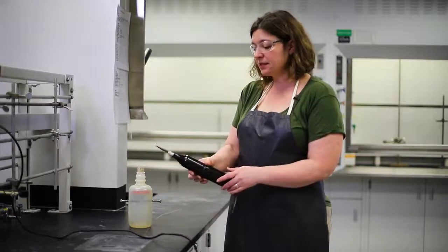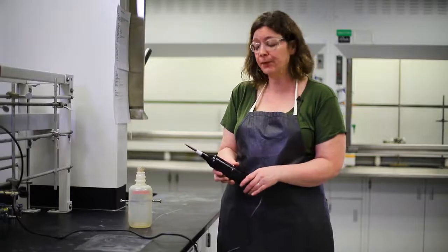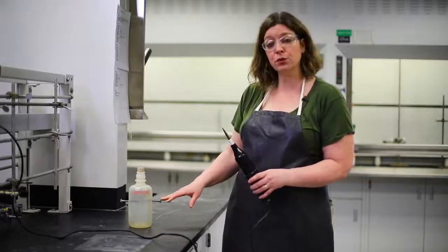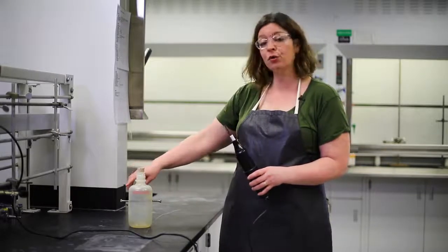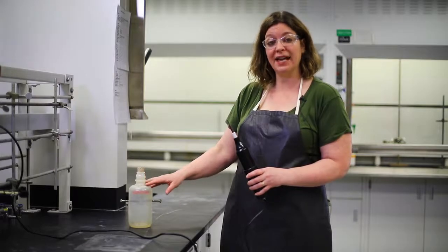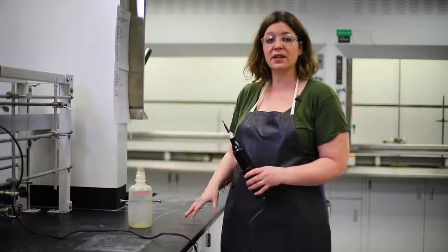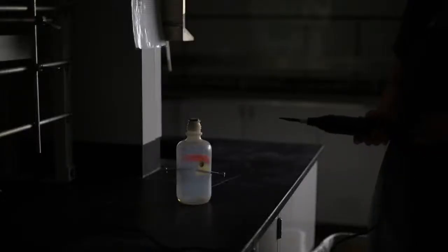I'm going to take a Tesla coil, which is an electricity generator that you may have seen if you've ever taken a physics lab. We're going to take the Tesla coil and touch one of these metal screws. When that happens, an arc of electricity is going to jump across to the other screw, and it's going to ignite the vapors inside this alcohol cannon. And when that happens, it's going to burn so fast that the cork is going to come flying off. So I'm going to turn the electricity generator on, and we're going to cause a spark.